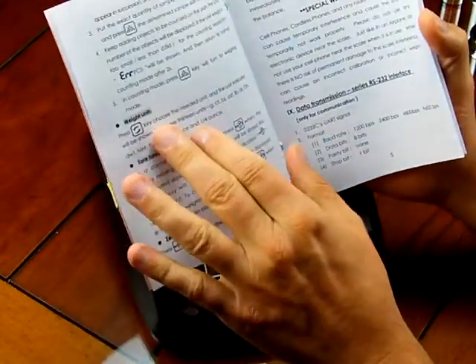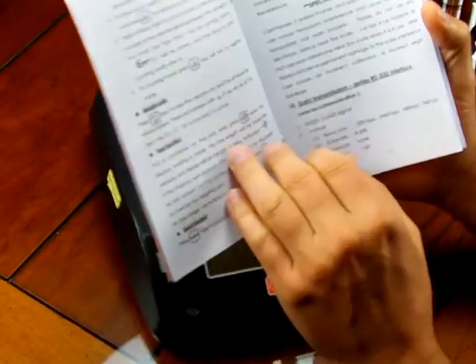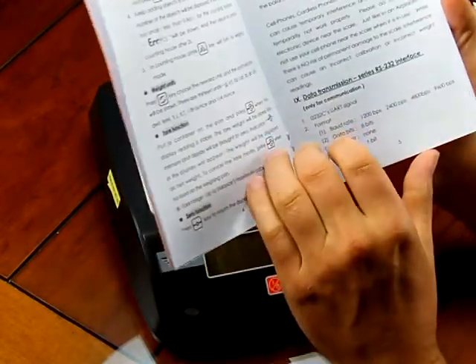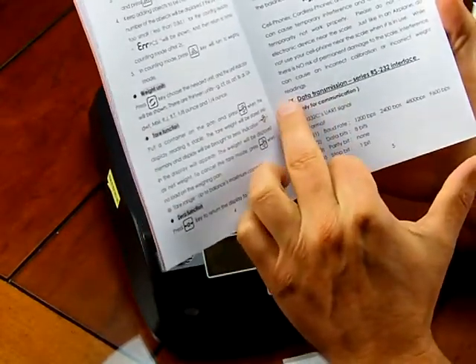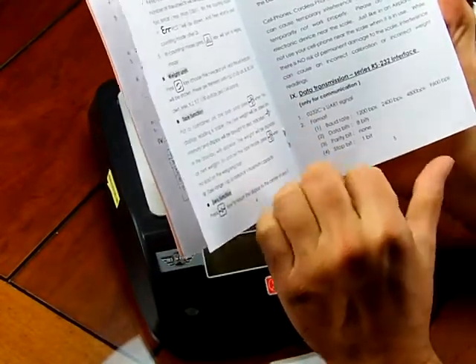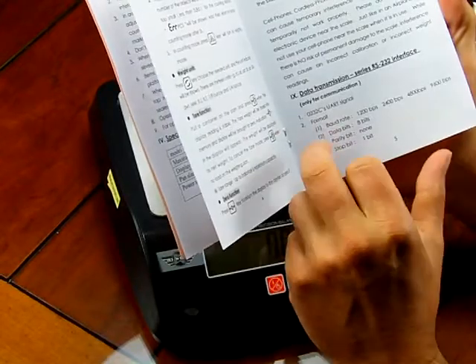how to do the sample, how to change the unit weight, which we went over in this video, the ability to tare, the ability to zero. And then again, this is the information on the RS-232 interface. So on this particular scale, you are able to change the baud rate.